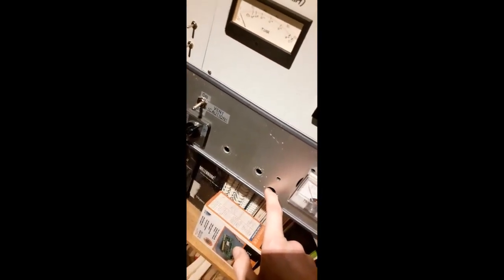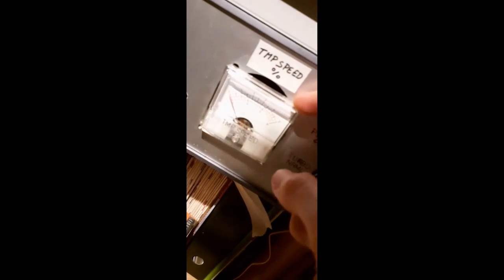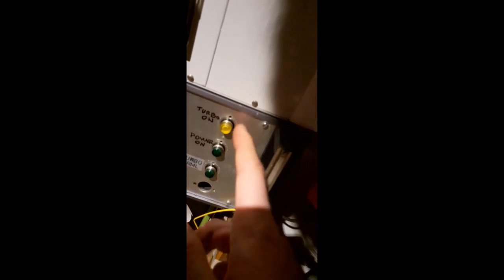I might show a video at some point showing what's inside it, but it's not very interesting. It's really just two Meanwell switch mode power supplies in series to get the 80 volts. It has an on-off switch here. It has a turbo pump speed output here, 0 to 100%. And that's just also a signal furnished by this little unit here, so there's no trickery there. Nothing I've built myself. Well, I've built it myself, but you know what I mean. It's not very hard. It's just adding gauges and dials and a few indicator lamps here.